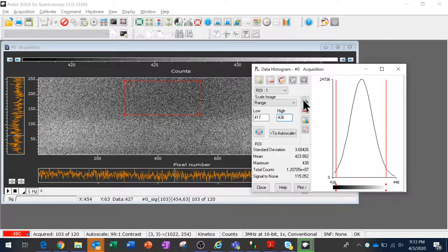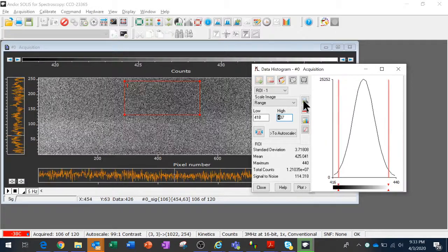I could wait around for the cooling to hit the ultimate level that I set. But for now, I think my point is made.